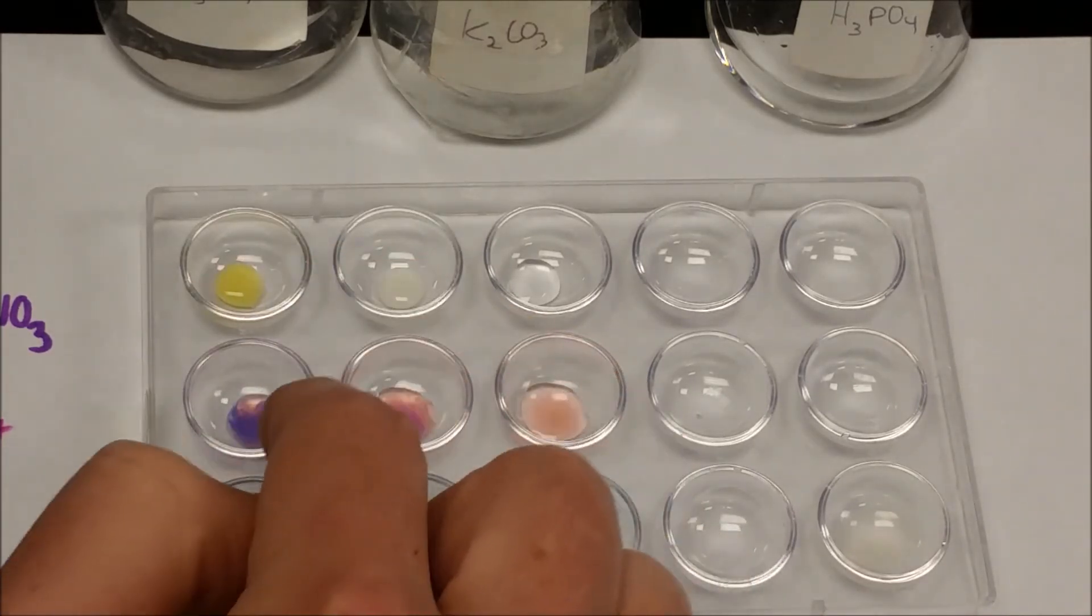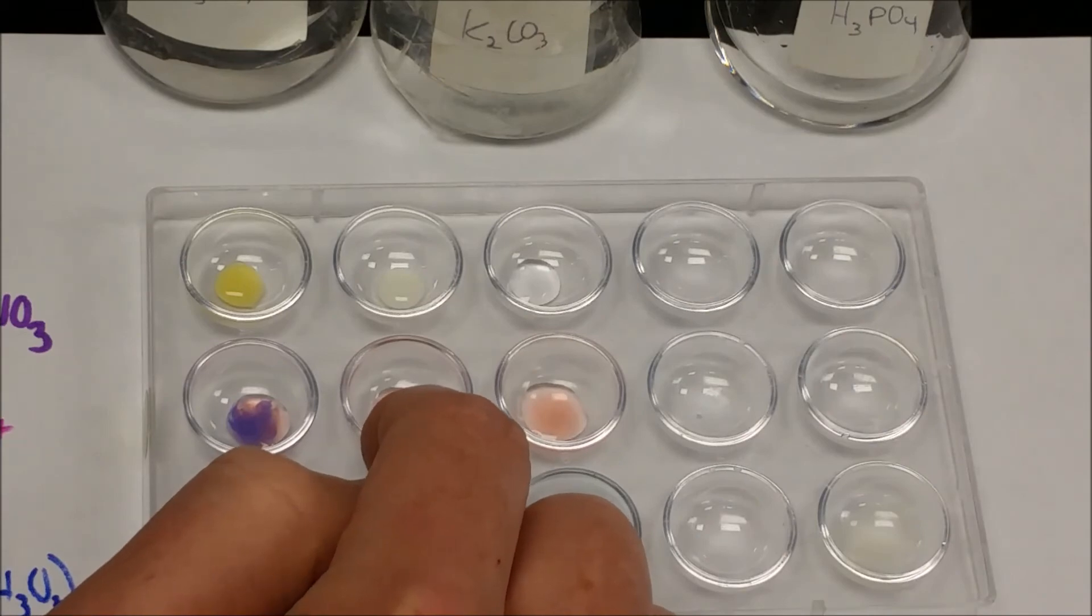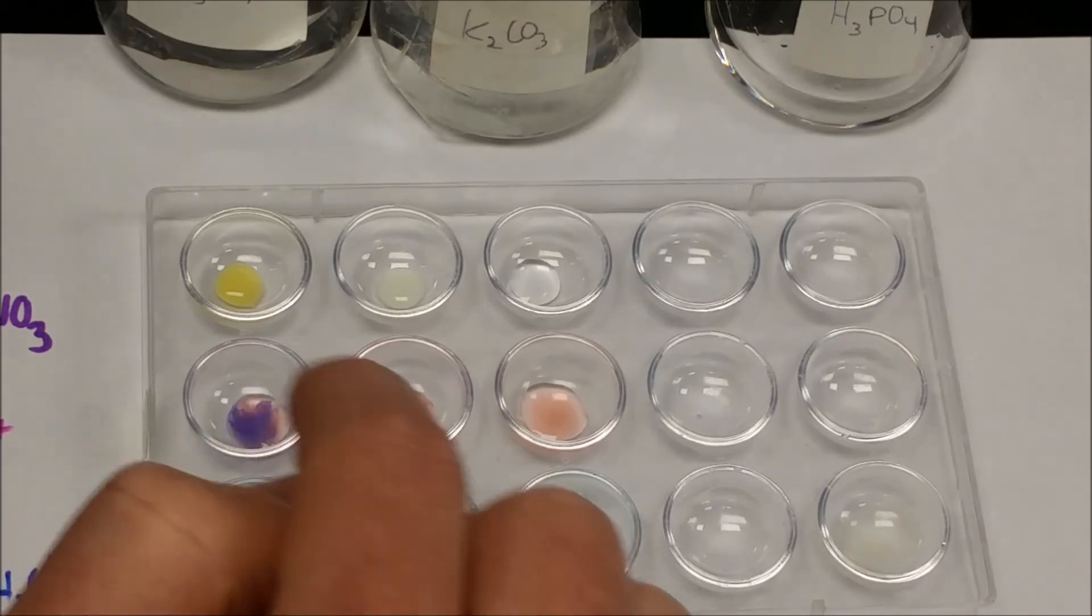However, you can see here clearly there's a difference between these two. This one has kind of a pinkish precipitate. This one is purple.